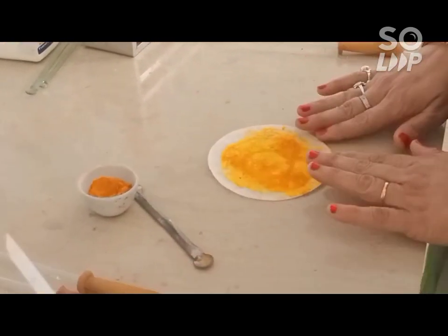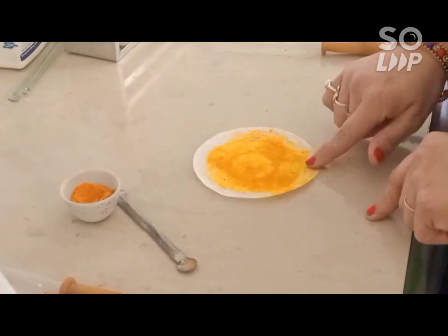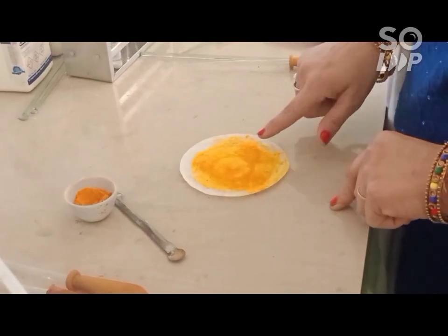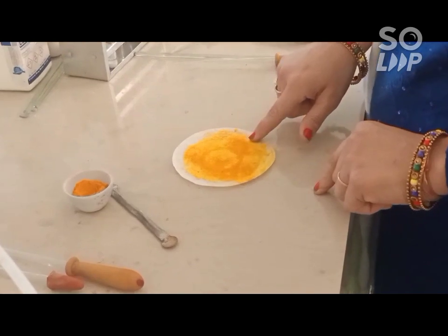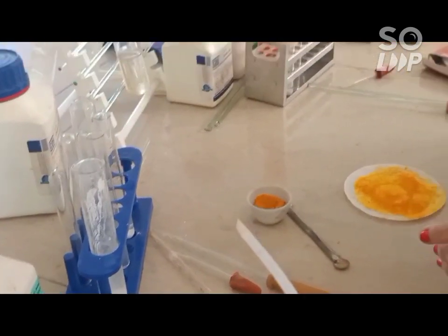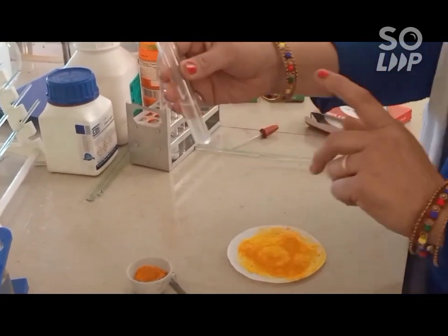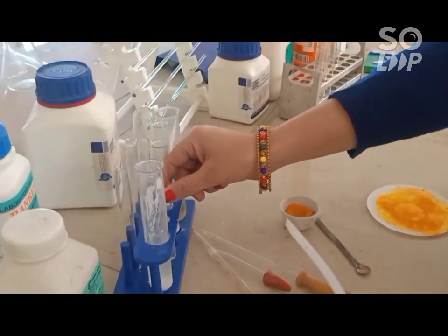As you all know, turmeric when it reacts with a base will turn to a reddish brown color, and with an acid it will not change its color. That's why we can use turmeric as an indicator. Here I have calcium carbonate and sodium hydroxide solution in this test tube — these are bases — so let's start.